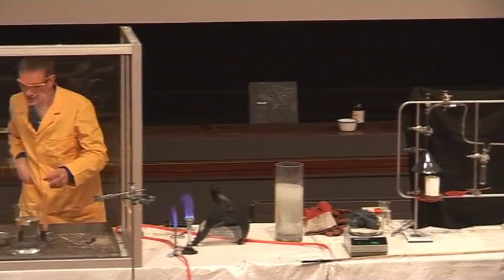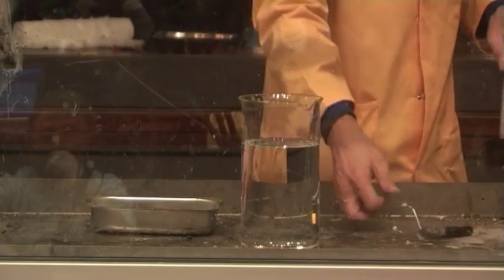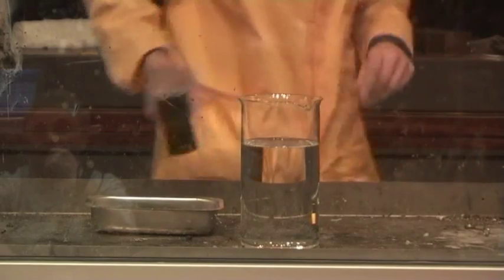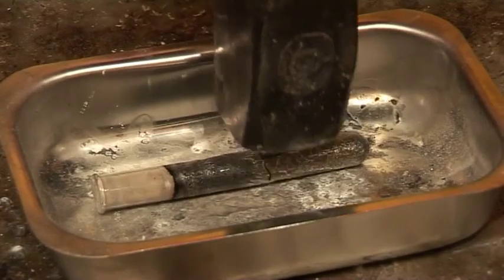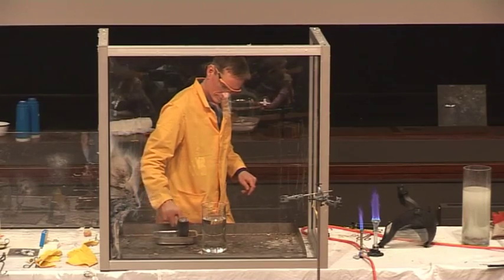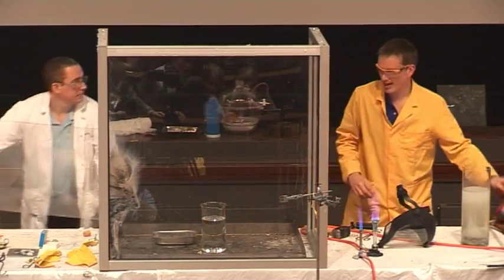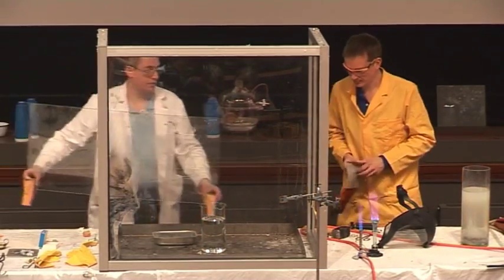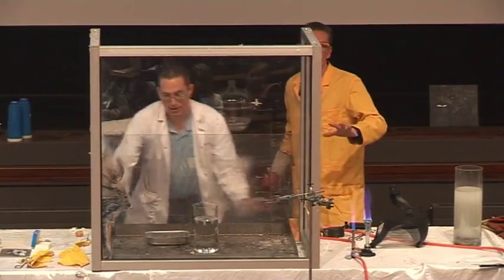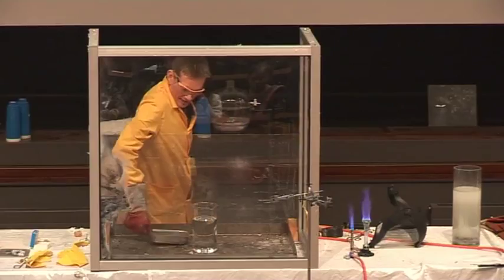We should be able to show this. I'm going to take the test tube that we've just heated up, smash it up, and then tip this into some acid. We should be able to see some of the crackling that we had before. If we just have the lights down, please.